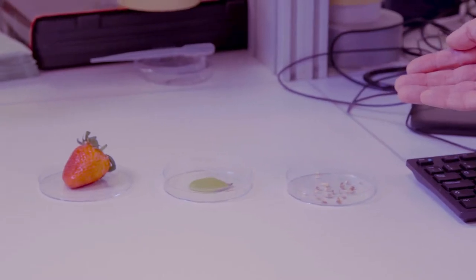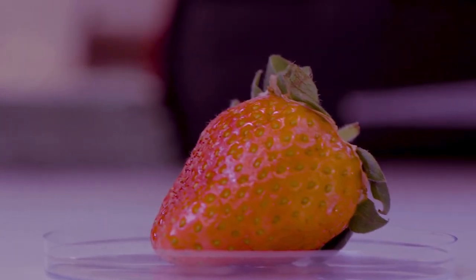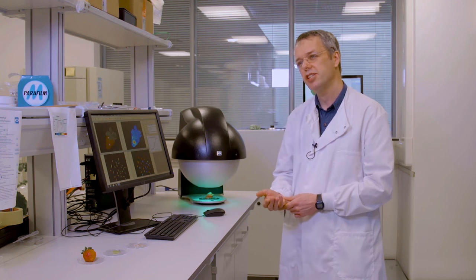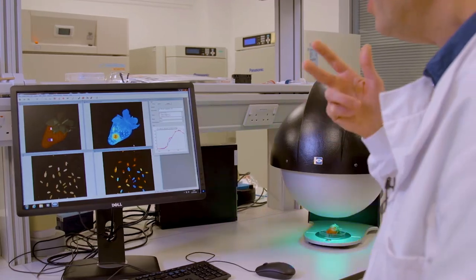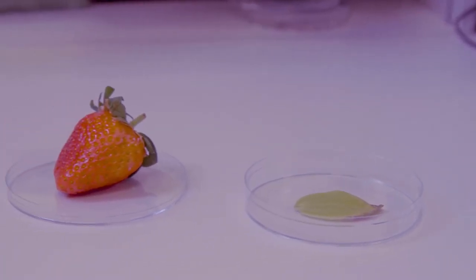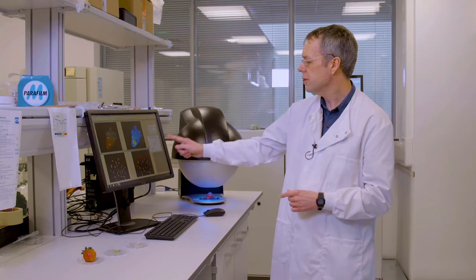For example, with the strawberry — if I was working with a company that wants to develop a system for the remote picking of strawberries, you need two components. First of all, you'd need the hardware, essentially the cameras to image the fruit, but then you'd also need to know the optical signatures for healthy and diseased strawberries, and that's what I can define using this equipment.